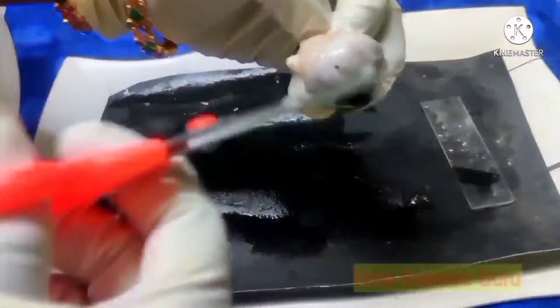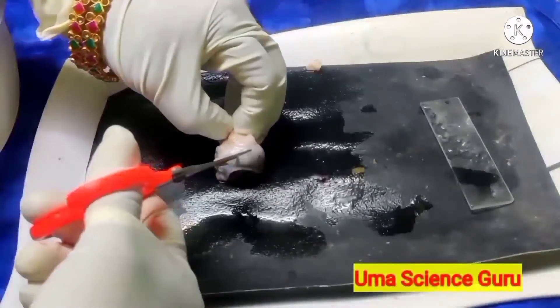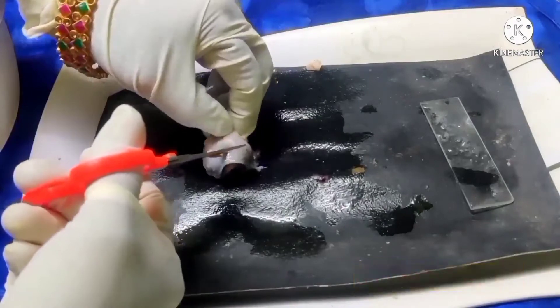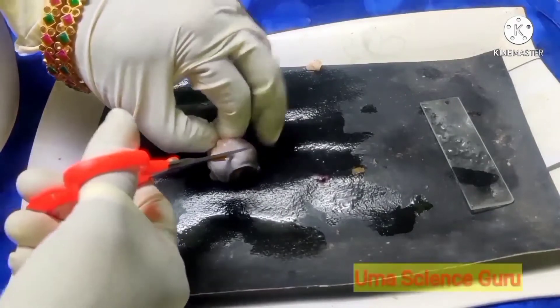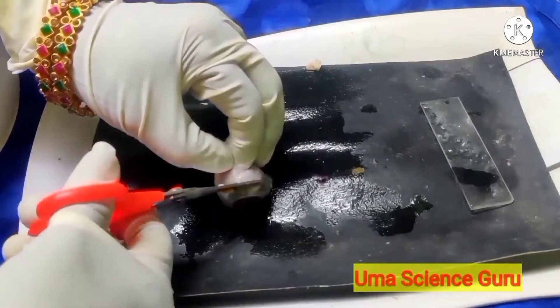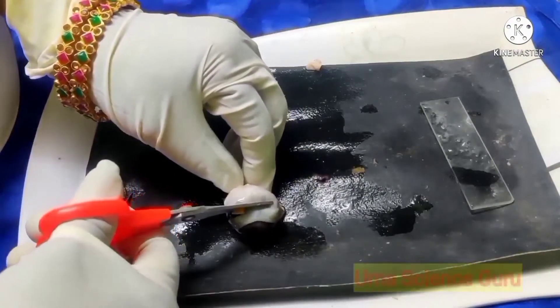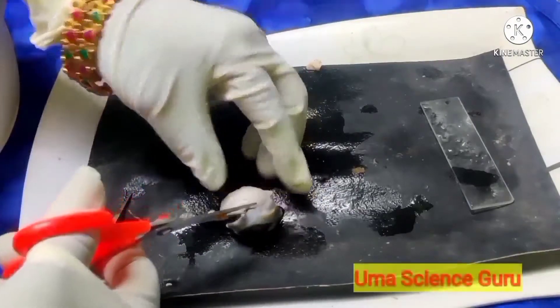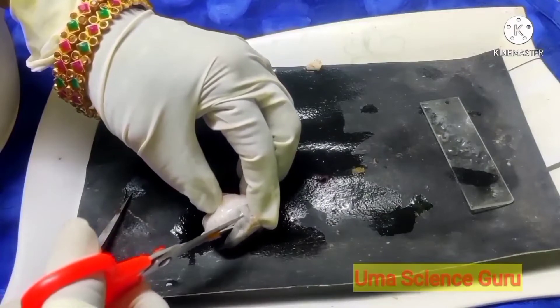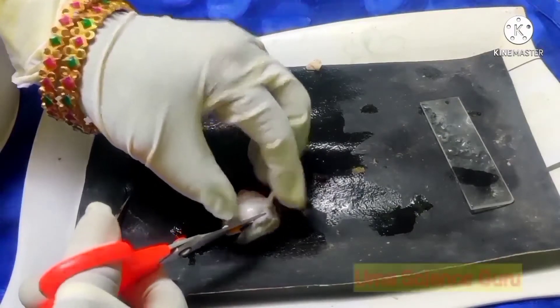Students, let us observe the dissection. First, make a hole in the sclera region and cut through the sclera. Students, observe the sclera — it is very hard to cut the sclera portion. This is because it is made up of tough, thick, and fibrous non-elastic tissue.